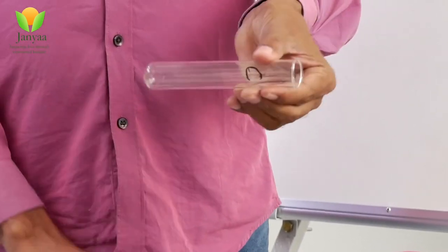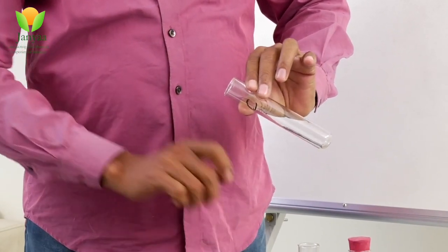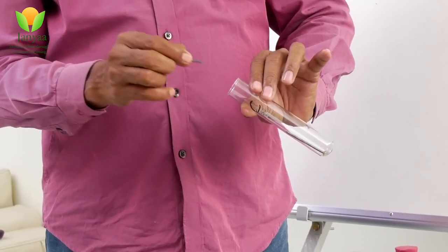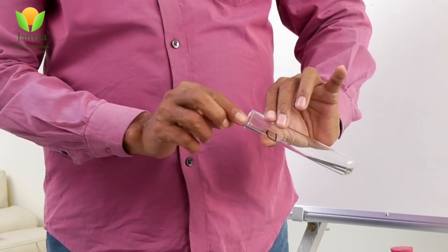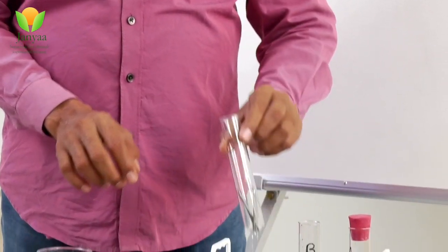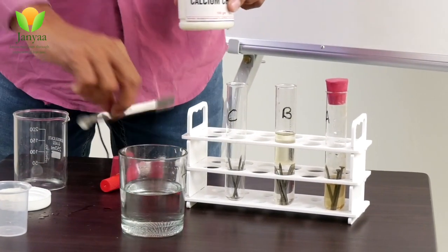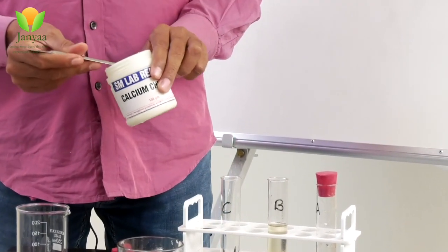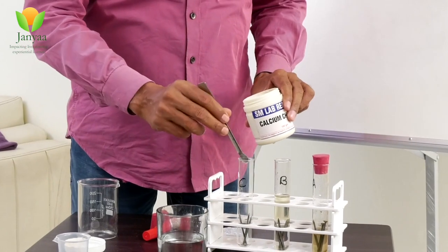In the third test tube C, I don't pour any water or oil — just placing nails inside. Take care while dropping them; place them gently along the walls. Now I put some anhydrous calcium chloride in it. The role of anhydrous calcium chloride is: if there is any moisture, it absorbs that moisture — meaning water vapor won't be available in that test tube.